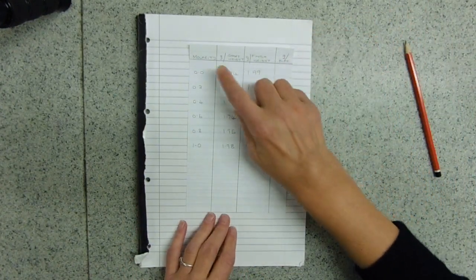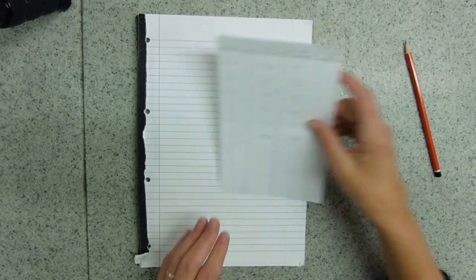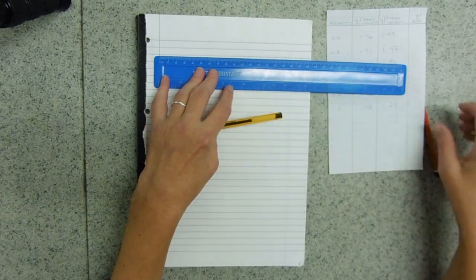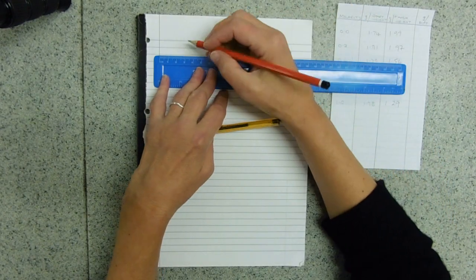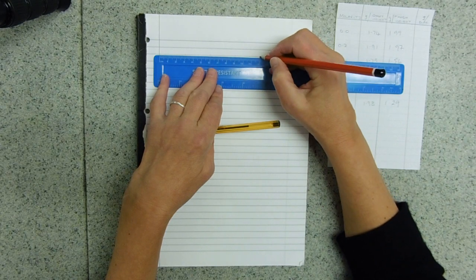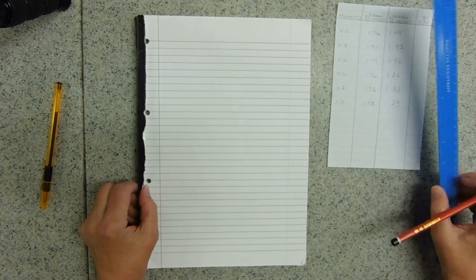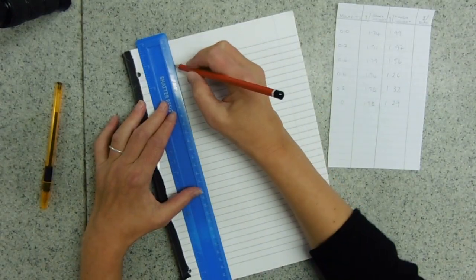So a percentage difference. I'm planning my results table now — five columns. My page is 18 centimetres wide, so I'm going to do three centimetre columns. And I don't know why you wouldn't use a ruler for this. Why wouldn't you think — a ruler, that's a good idea. I'm going to take my line all the way down.